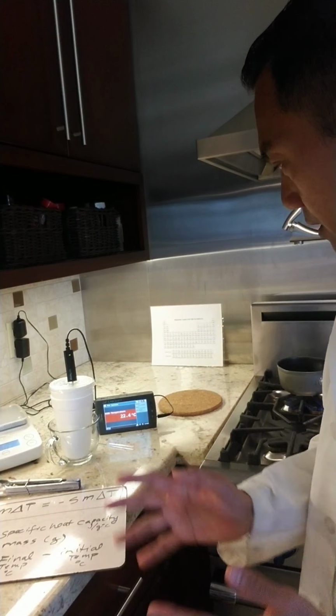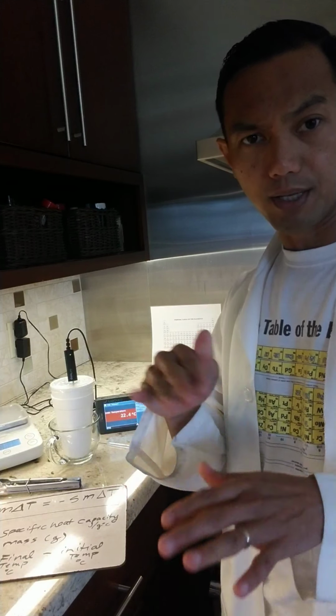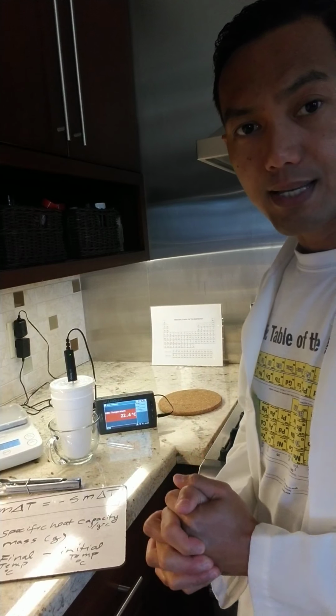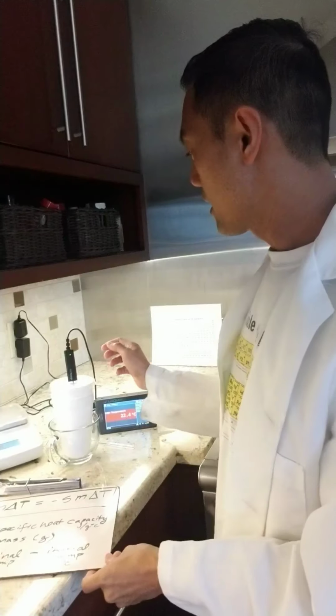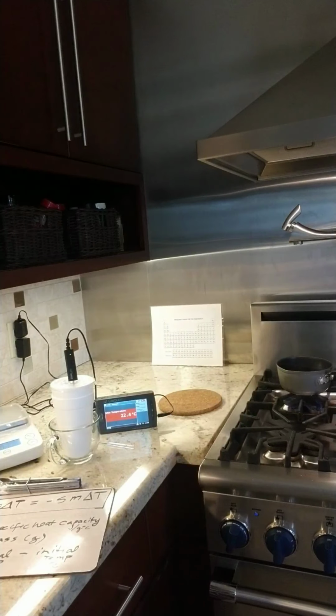All right, I think we can call it 22.4, because it's now our third or fourth measurement that stays within that value. So if that's the case, then I could stop this particular experiment for metal A. And I'm going to get a paper towel to dry up our metal.